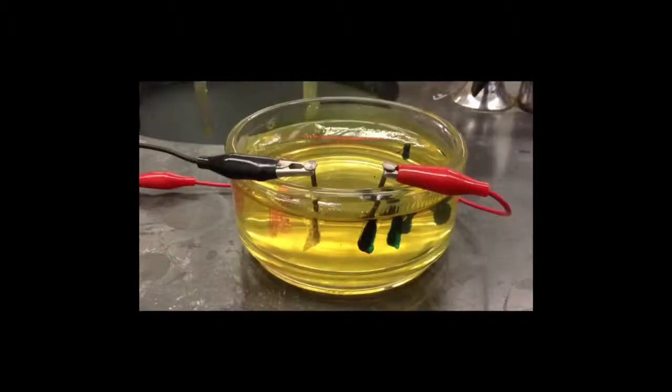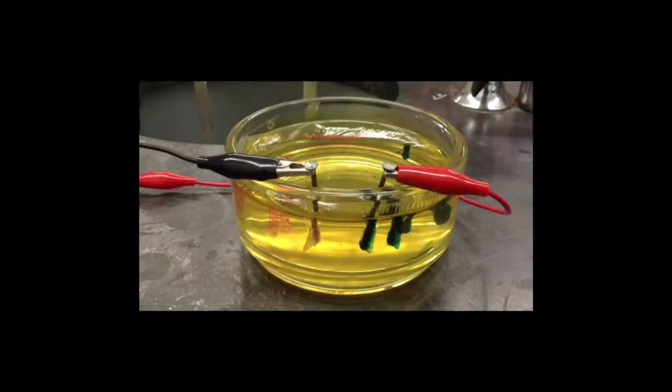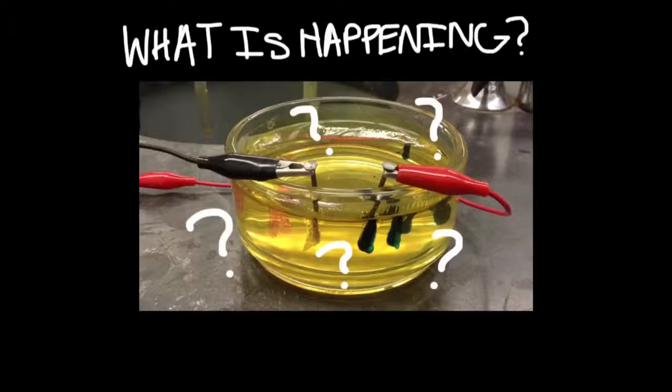Here's a faster version of a different trial. Also note the bubbles forming around the pink color. Now let's figure out what's actually going on here.